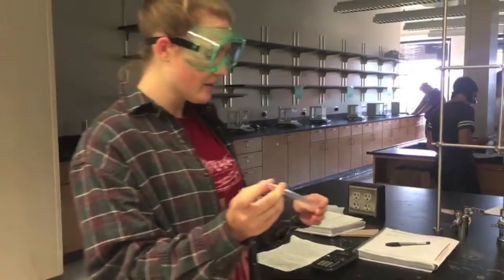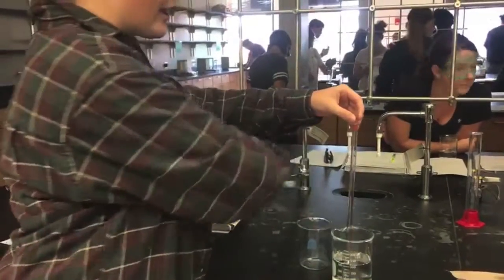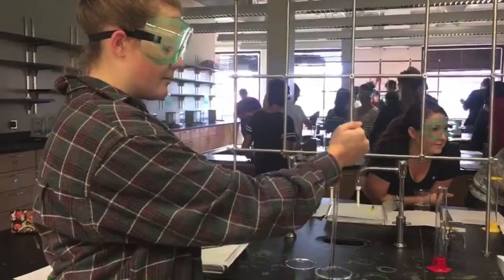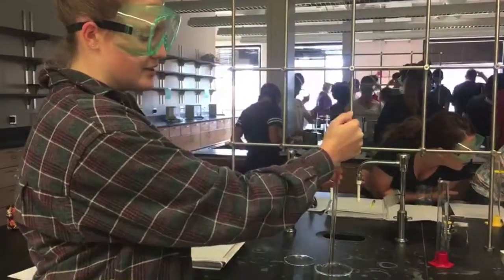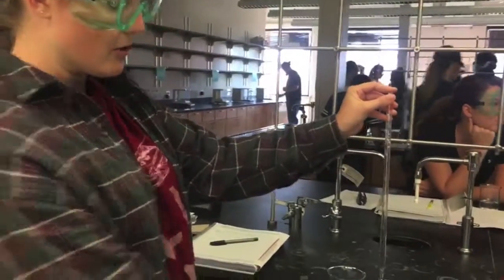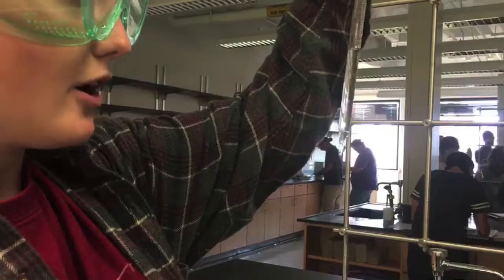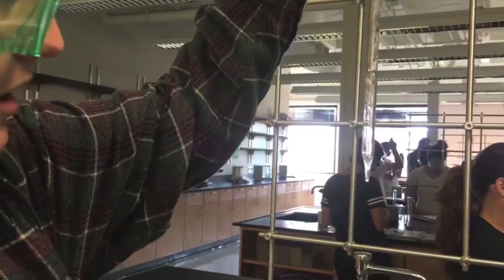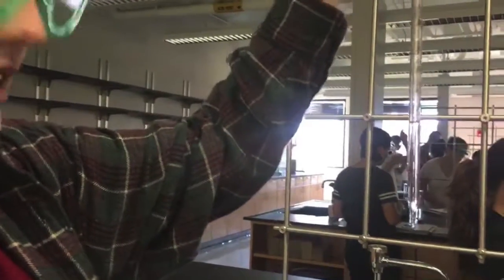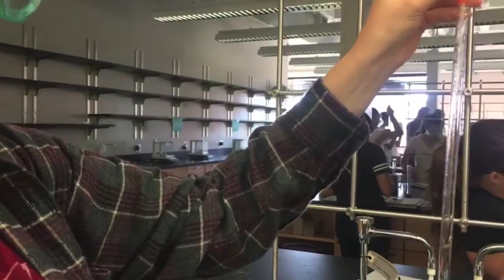To measure volume, you first push the pipette down into the water. You pick up the bulb, put it on top of the pipette, and then release your grip on it. Remove the bulb and replace it with your finger so that the water does not run out. To read the pipette, you bring the meniscus, or this water curve, to eye level, and you read the bottom of the curve, 7.31. You need to add the last decimal point as a point of uncertainty.